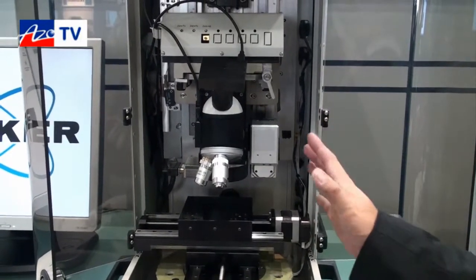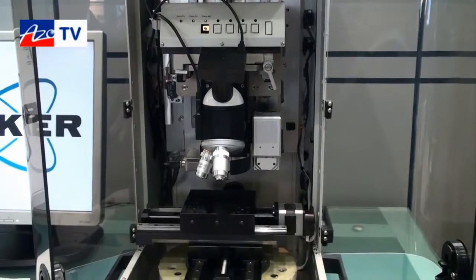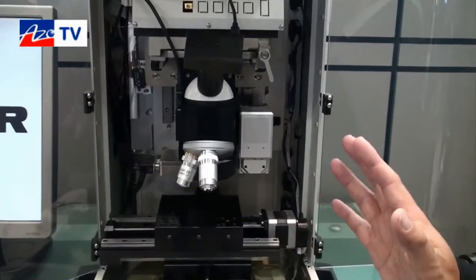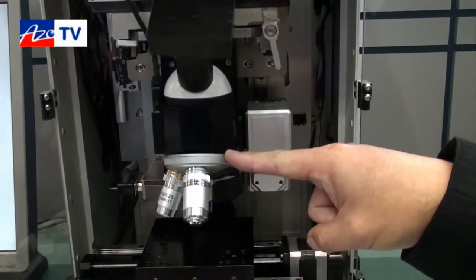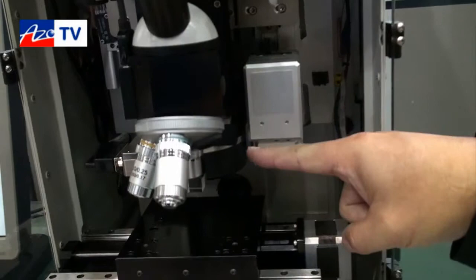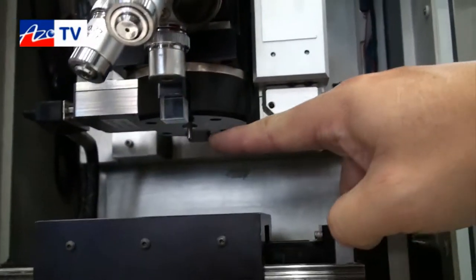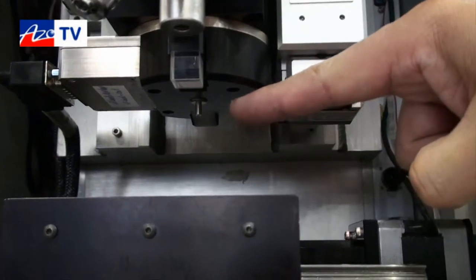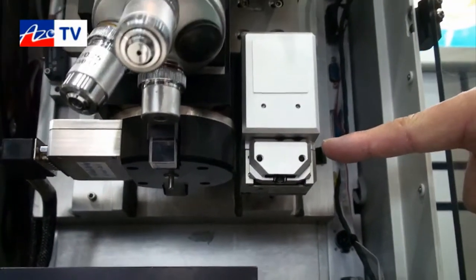This is the APEX configuration for nano. It's set up with three main components. As you can see here in the front, you have the optical microscope. Behind this we have the nano head, which you can see from the bottom. This is the shaft where we can attach the Berkovich indenter, and next to it we have the AFM.